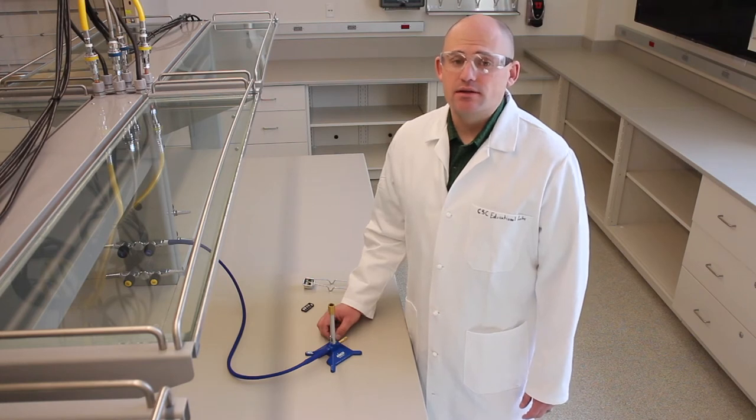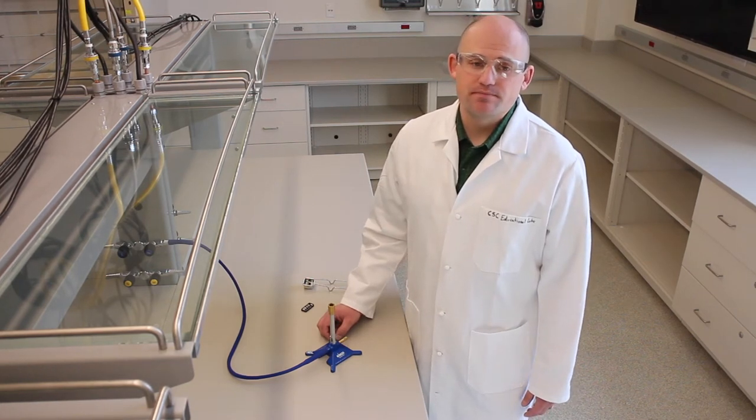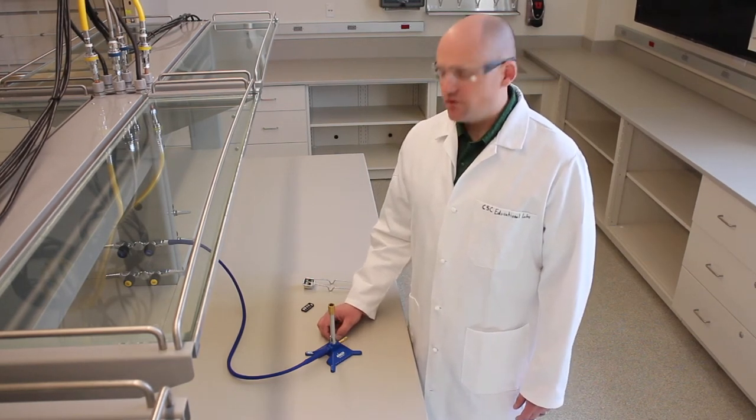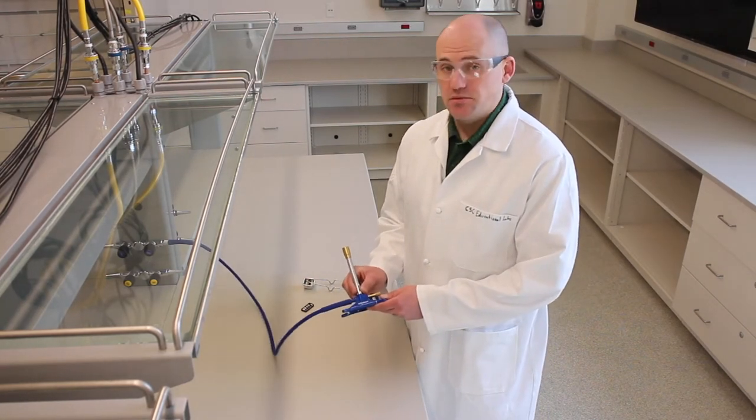Welcome back to the Crocker Science Center Laboratory informational video series. Today we're looking at how to use another fundamental piece of laboratory equipment, the Bunsen burner.